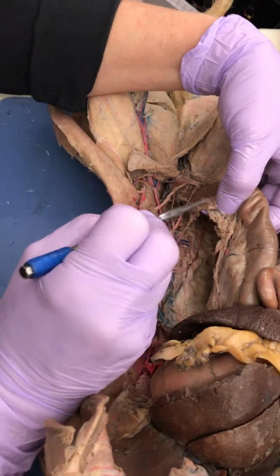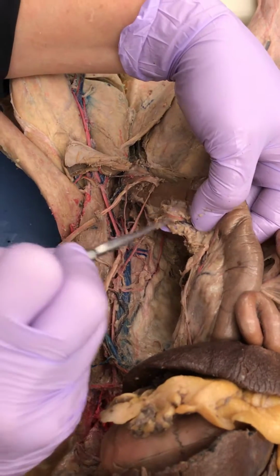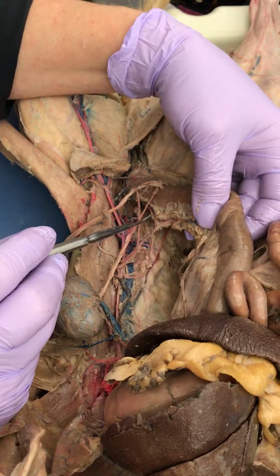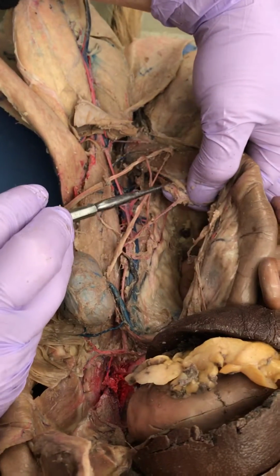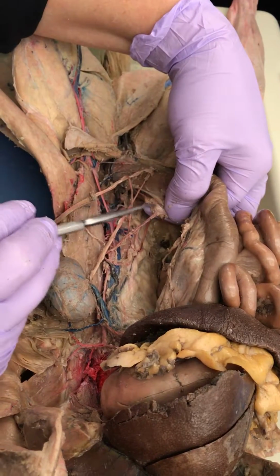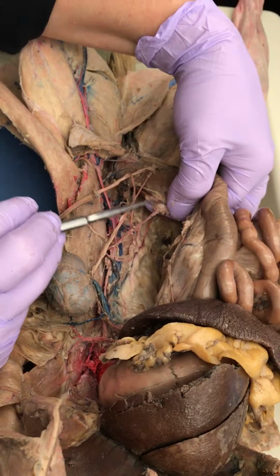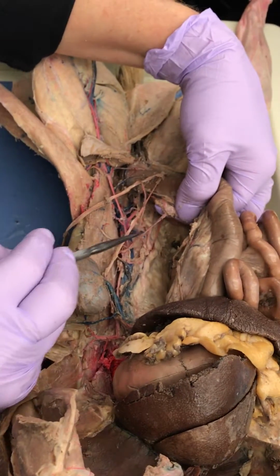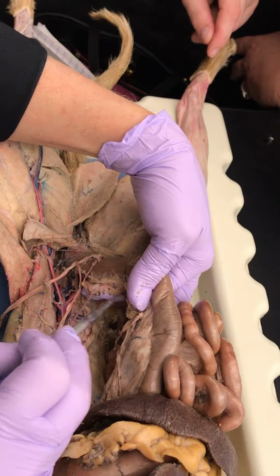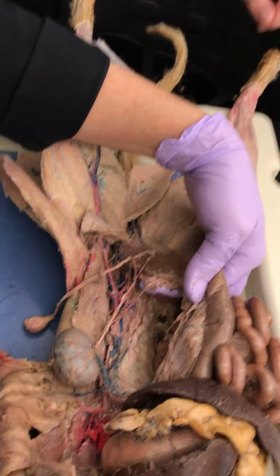I busted that vein, sorry, but maybe you can see the colic a little bit better with that vein out of the way. The pink line. But it is a little weak. This one's not bad down here. This one that's going down. What's that one called? Superior hemorrhoidal. That pink one right there. Okay, so as Casey said, this is the inferior mesenteric, and then it's going to go up and make the colic, and go down and make the superior hemorrhoidal.